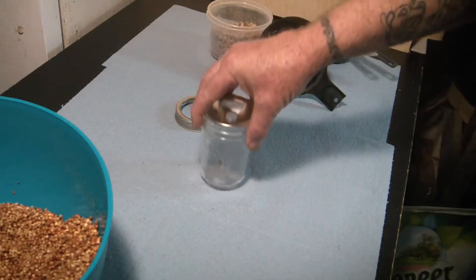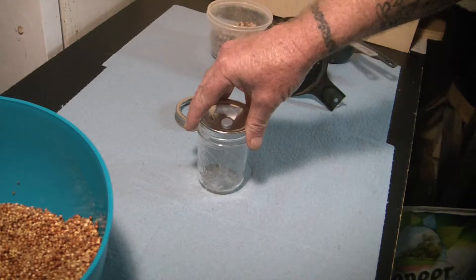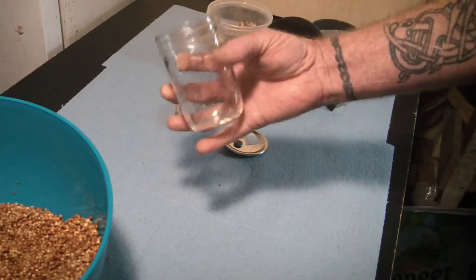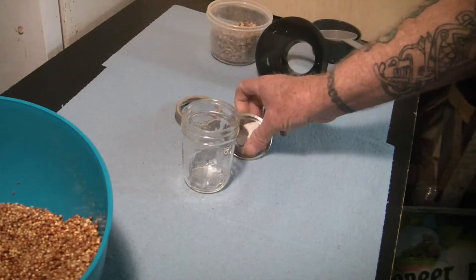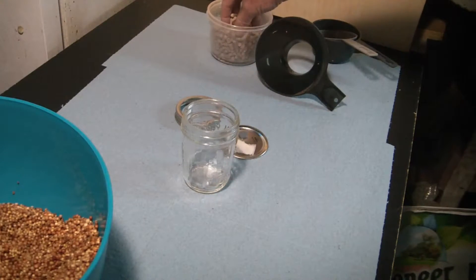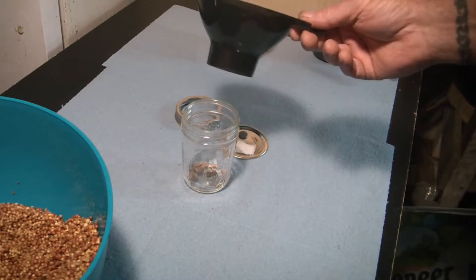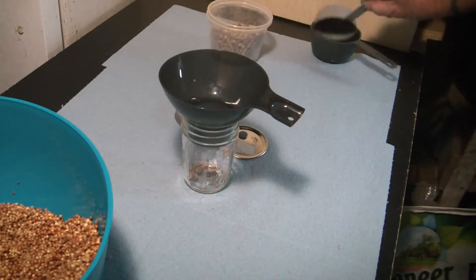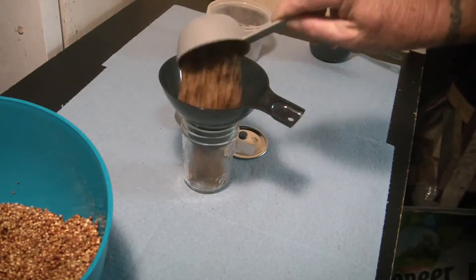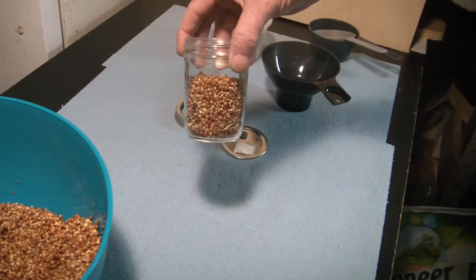If you're not set up for agar, or like me you don't want a hundred plates sitting around doing nothing and just being a waste, here's a really great tip: the mini jar. This is a half-pint straight-sided jar with a regular mouth on it, and I set up lids that are exactly the same as a full-size jar. These take one-half cup of grain, and that's it — a little mini jar.